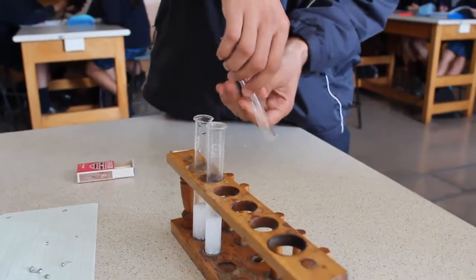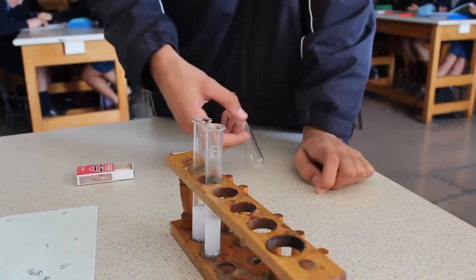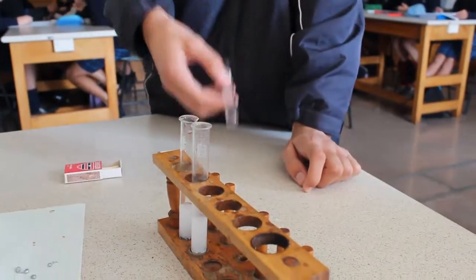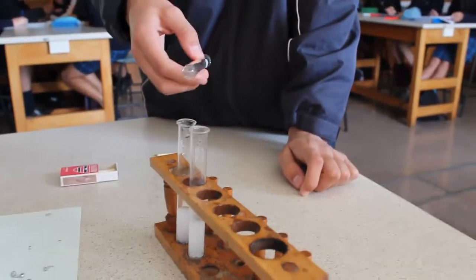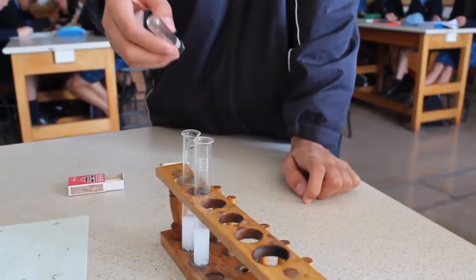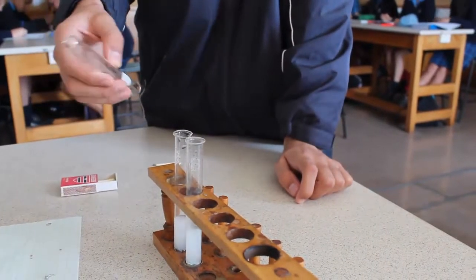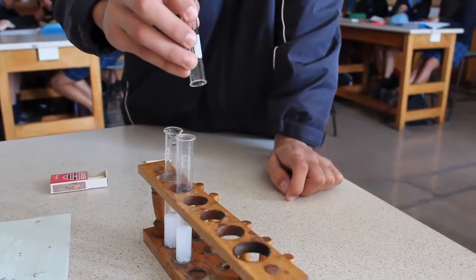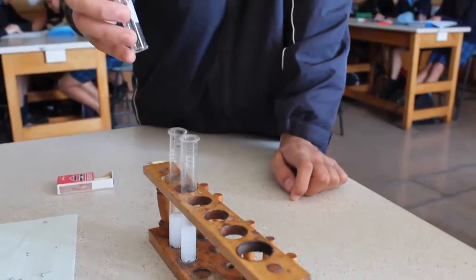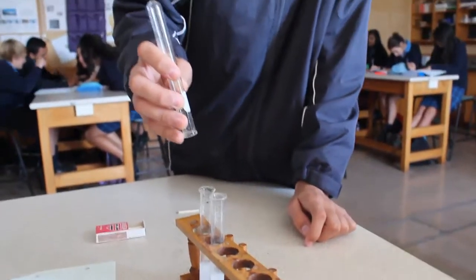Okay, we're going to try to identify the gas that's produced by this reaction. We know that whenever you react a metal with an acid, a metal salt will be produced and hydrogen will be produced. To prove this, we do a test called the pop test.